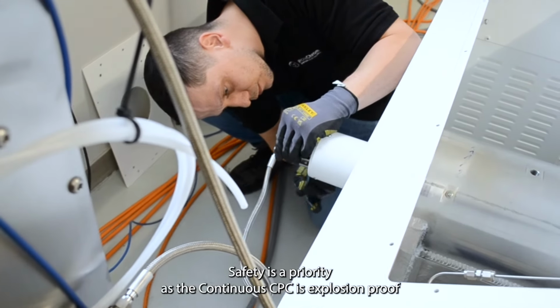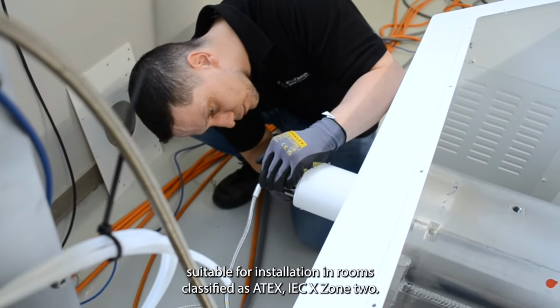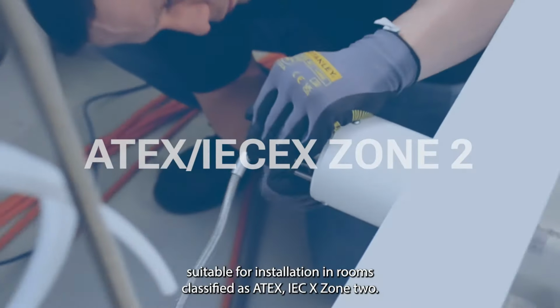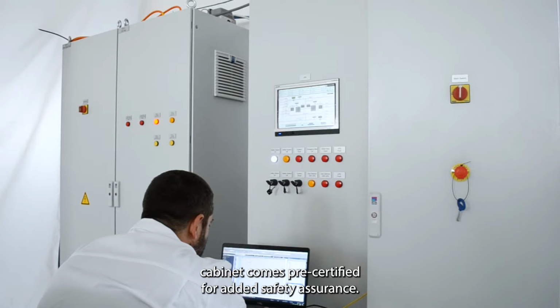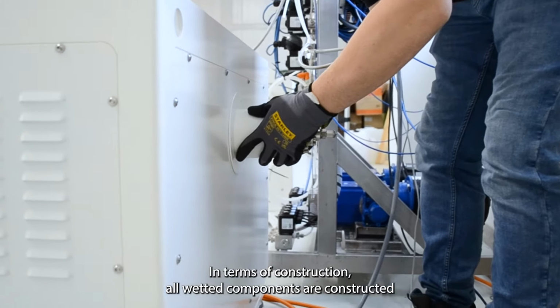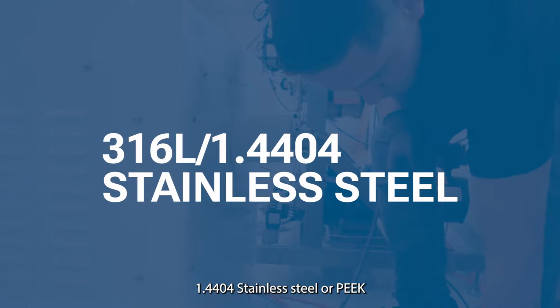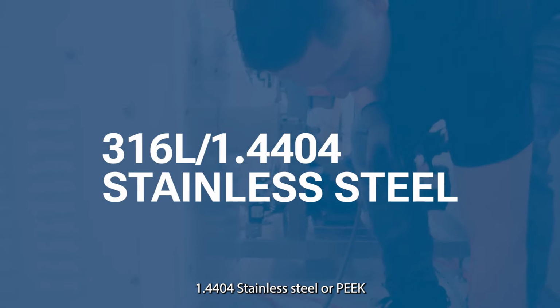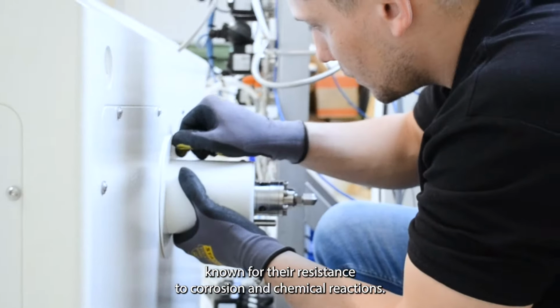Safety is a priority, as the continuous CPC is explosion-proof, suitable for installation in rooms classified as ATEX, IECEx Zone 2. Additionally, the electrical cabinet comes pre-certified for added safety assurance. In terms of construction, all wetted components are constructed from high-quality materials like 316L, 1.4404 stainless steel or PEEK, known for their resistance to corrosion and chemical reactions.